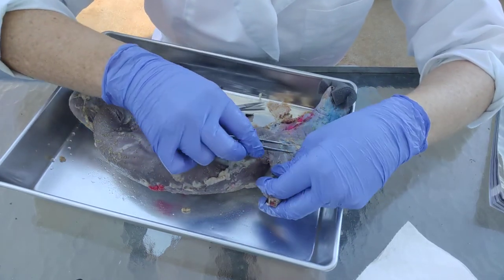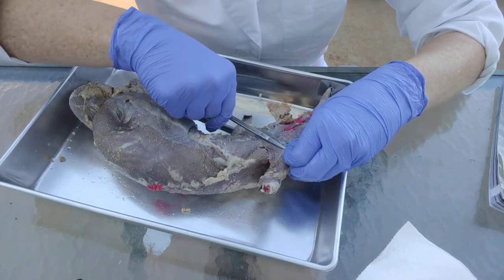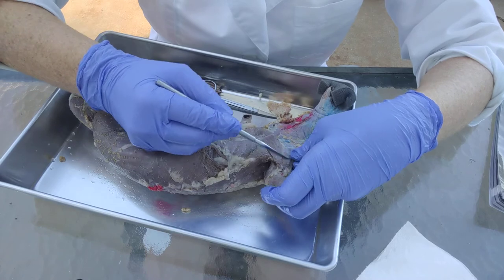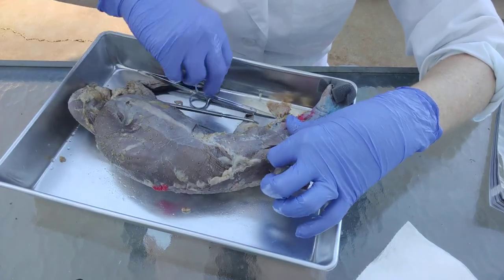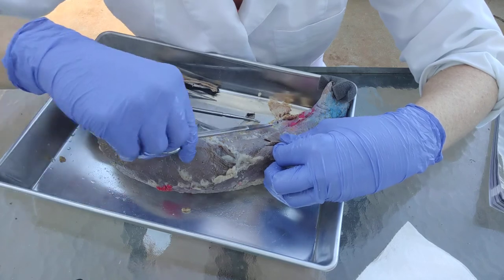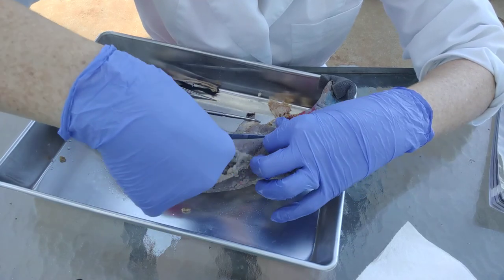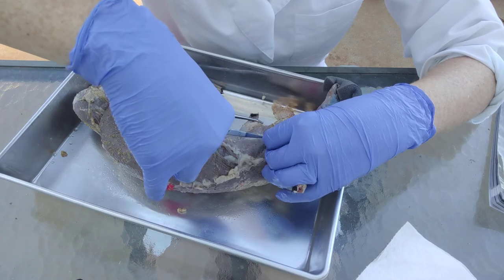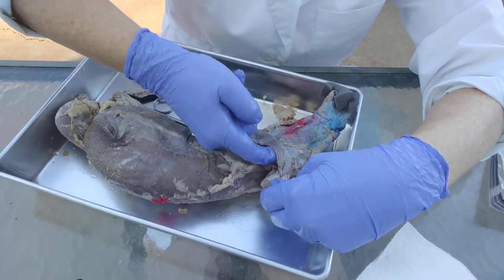It's very important that you have your lab manual open at the same time so you can see what the pictures look like. You need to know what the muscle looks like so you can figure out what shape it should be. I'm going a little bit quick because I know what it should look like already — you don't, so make sure you go slow. You can see how I can put my finger all the way along the full length of the muscle.